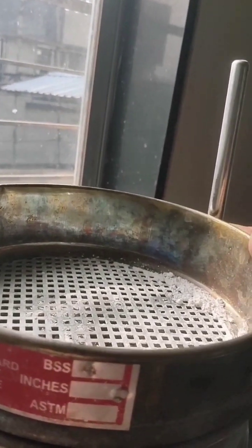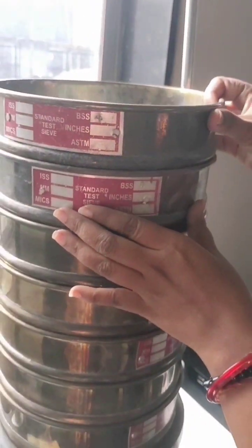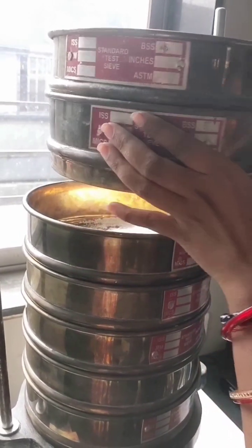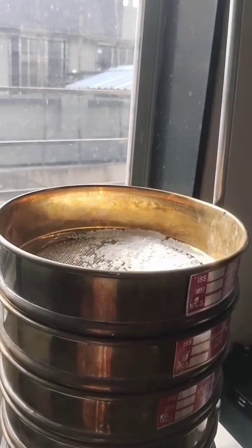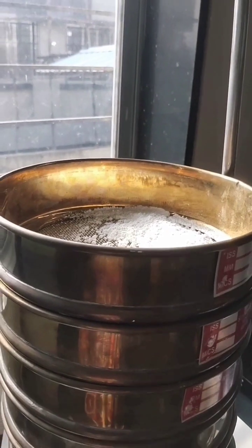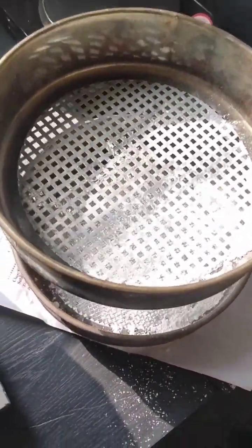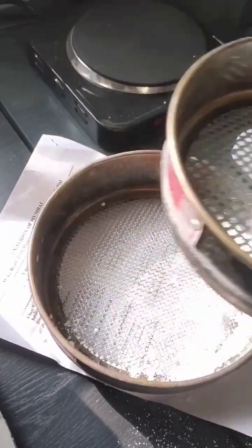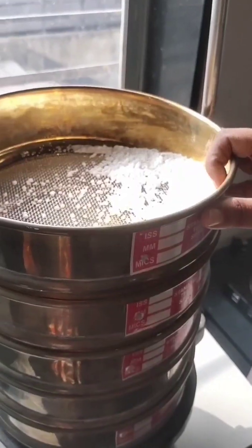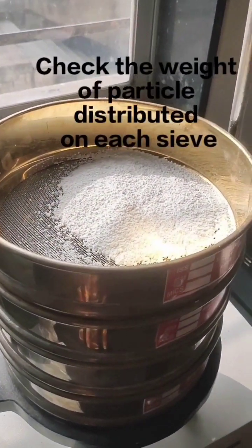Now we will see one by one the particles distributed on each sieve. Now we have received particles on each sieve. Check the weight of particles distributed on each sieve.